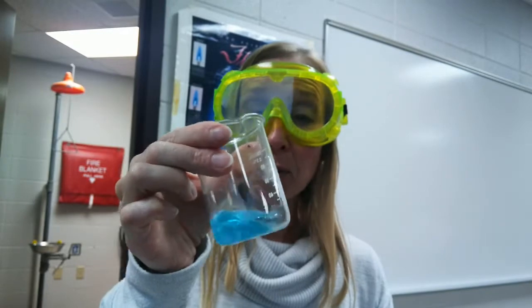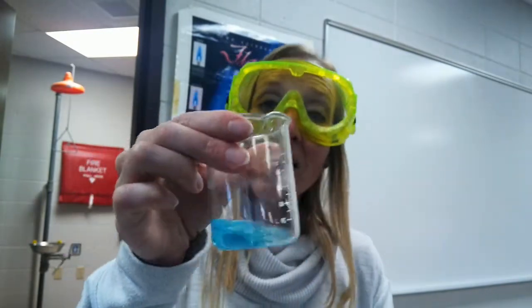To do that, we're going to use chlorine. Chlorine will form a solid with silver. Silver chloride is a precipitate. That's a solid that forms from the reaction of solutions. But copper chloride is not a precipitate. Copper chloride will stay in solution, so it should run through my filter paper.